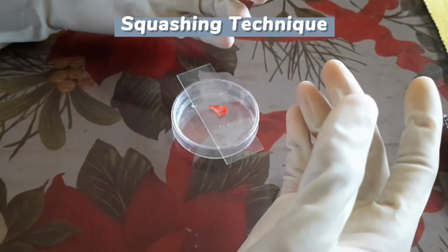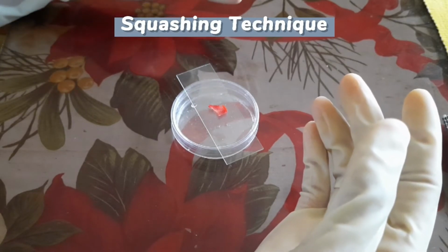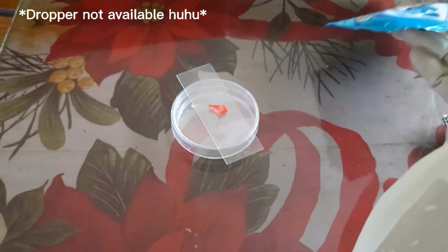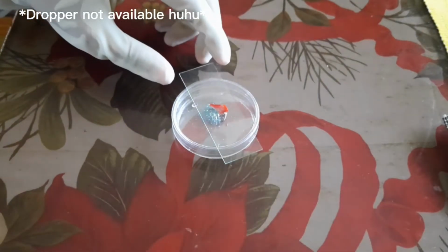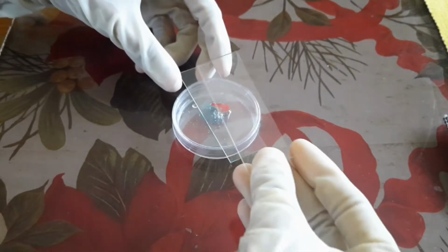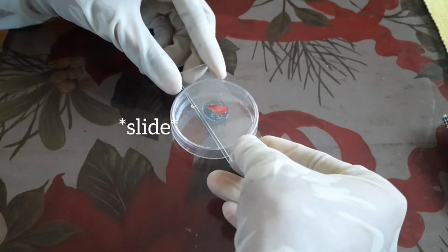We also have the squashing technique. To properly perform the technique, we will utilize the fourth step of the teasing procedure. Then, we will apply our methylene blue stain directly on the tissue slice on the glass slide. After applying the stain, cover the stained specimen with our cover slip and apply enough pressure to crush the specimen flat.